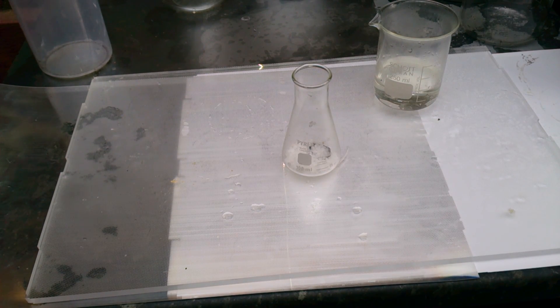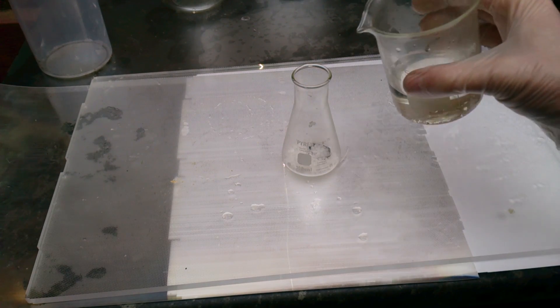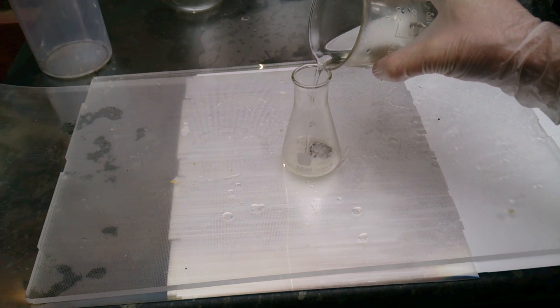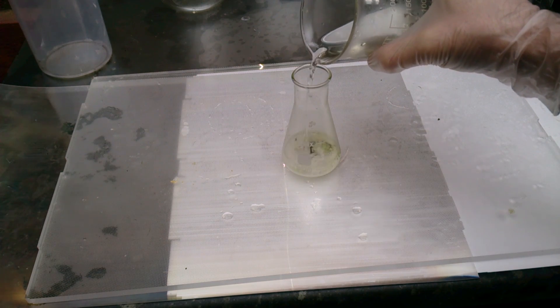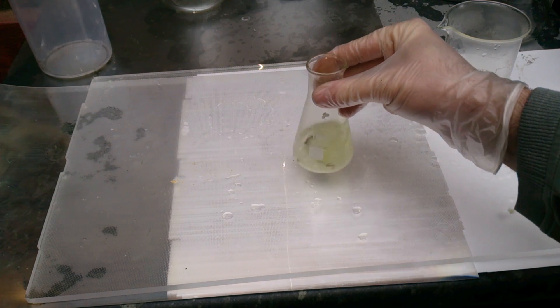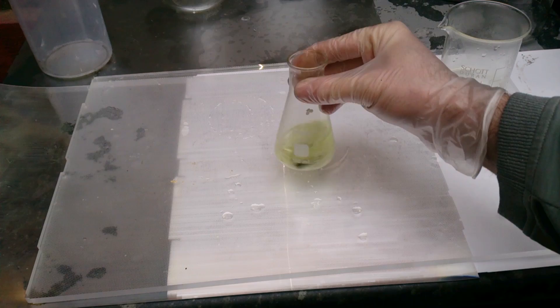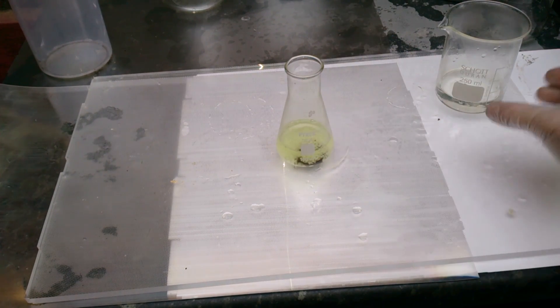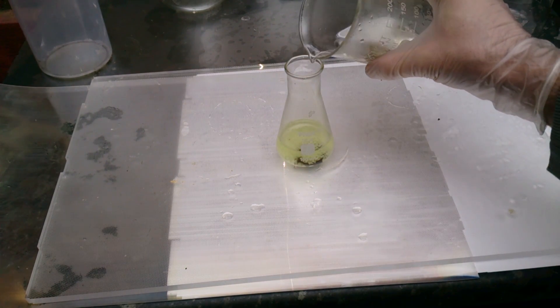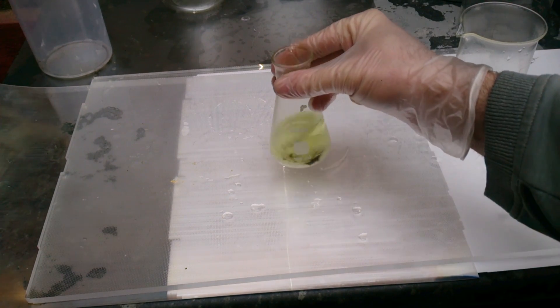Speaking about nitrate - you can use any nitrate, it will work to dissolve your gold. But I do not recommend using calcium nitrate. When calcium nitrate gets mixed with sulfuric acid, it will make something called calcium sulfate, or in other words, gypsum. Gypsum is absolutely insoluble and it's quite a pain to filter. Also, I'm trying to avoid ammonium nitrate - it's way too long a story to explain why, but let's say I just don't like it.